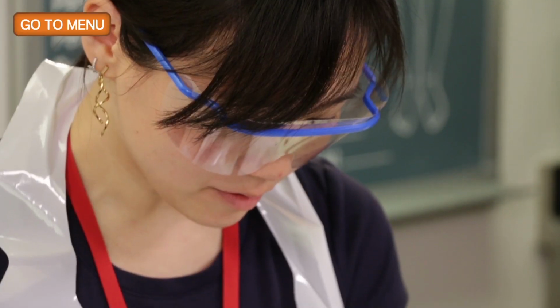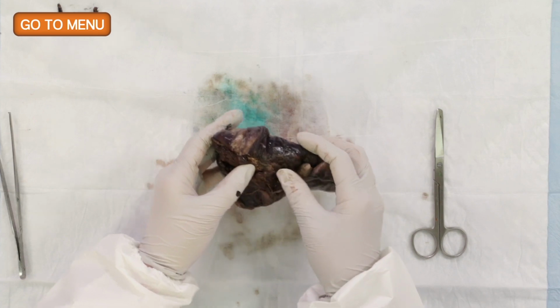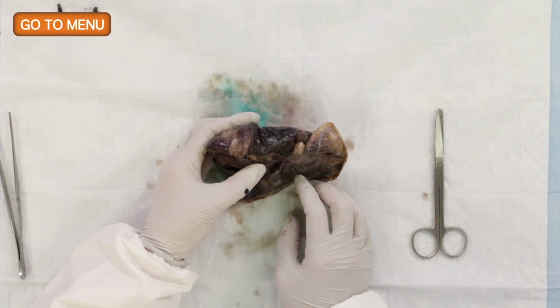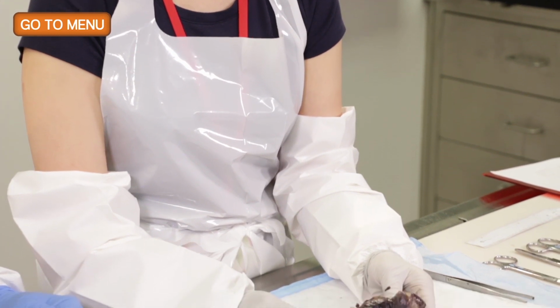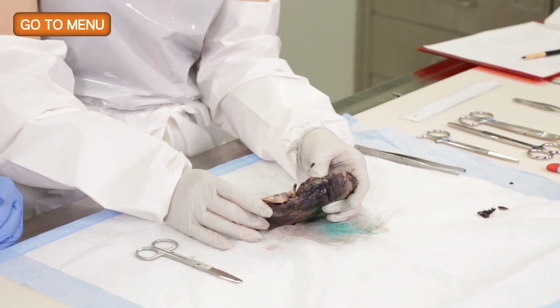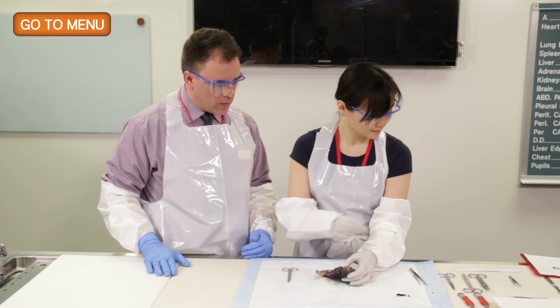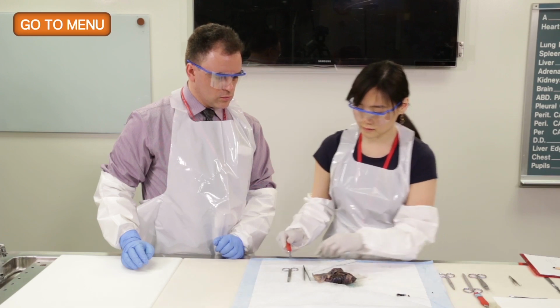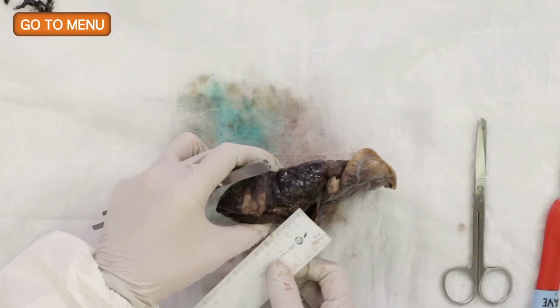Well, now what I would like to do is actually measure the bronchovascular margin. By removing the staples, I can actually clearly see where the bronchus is, where the artery and the vein is. So I think this will provide a better measurement. So you're going to measure the diameter of those structures, and then you're going to take sections from them, and you're going to essentially submit those as the bronchovascular margin. Yes, I will. And why don't you go ahead and do that then? Okay. And what I'm going to do now is I'm going to shave the vessels off. Actually, let me make a quick measurement, sorry.